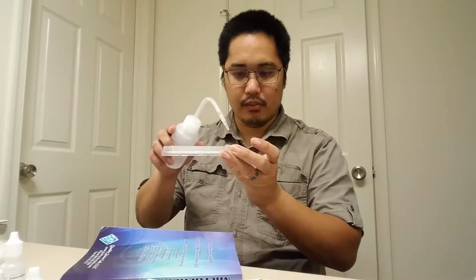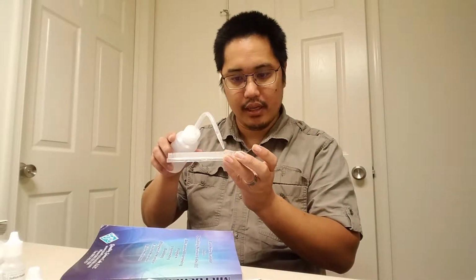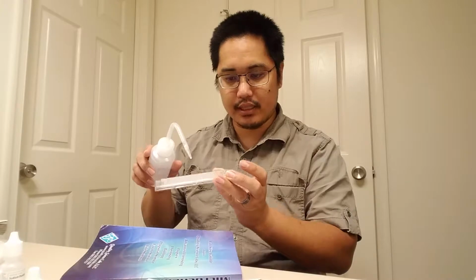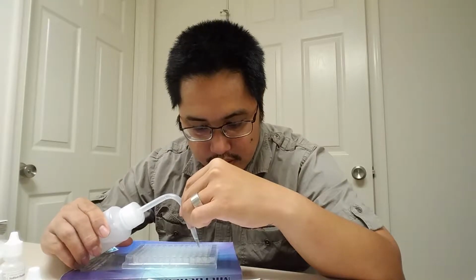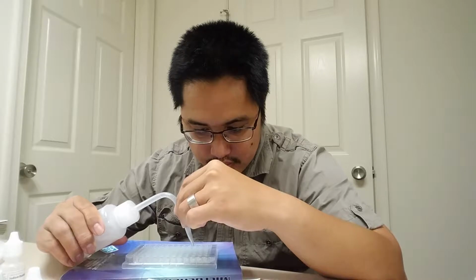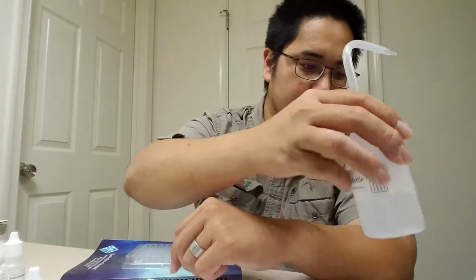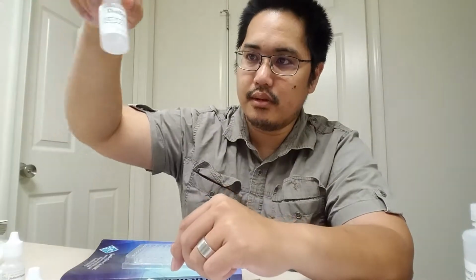Now, we're also going to take distilled water and put 4 drops in wells A2 through A7. So I'm going to skip well A1, and go A2, 3, 4, 5, 6, 7. I'm going to put 4 of these drops into each. Actually, to be honest with you, this is a lot harder to use than this one, and it's the same stuff.